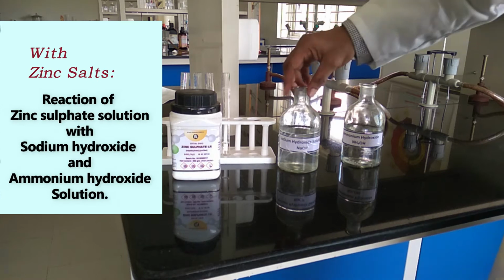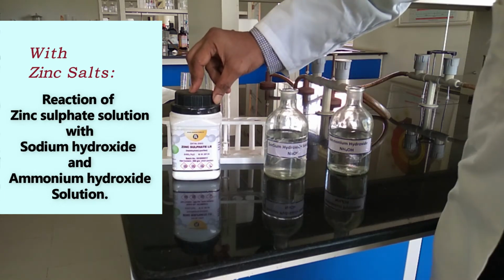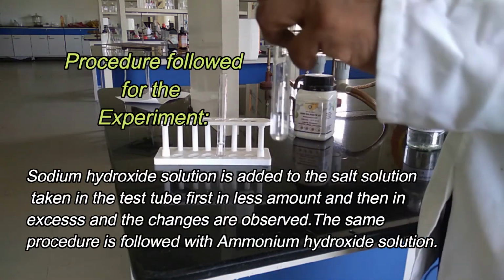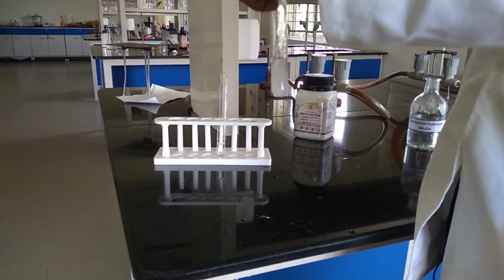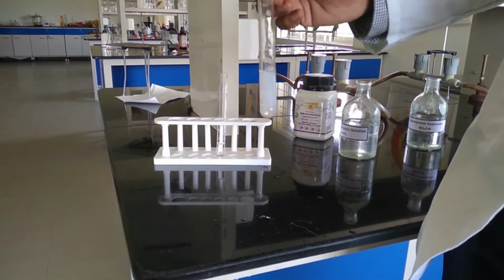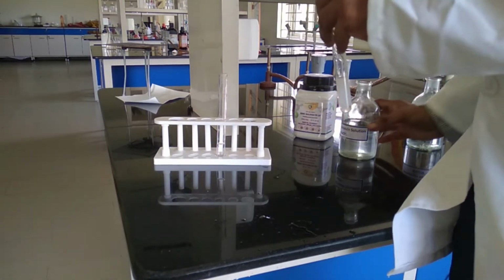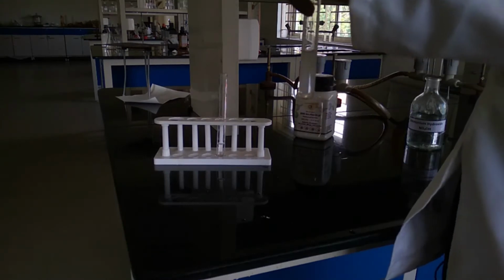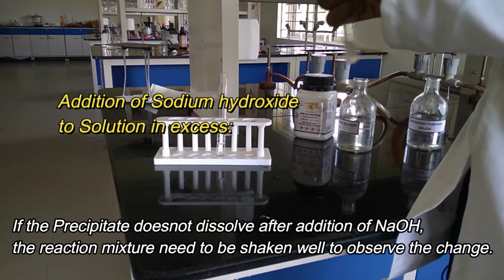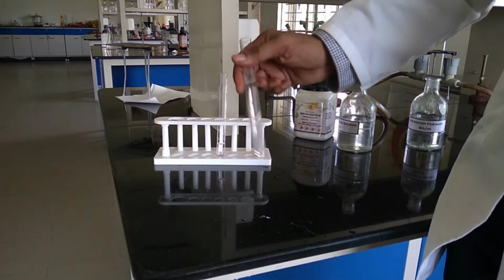Then we are going to see the effect of sodium hydroxide and ammonium hydroxide on zinc sulfate solution. First, we add a sodium hydroxide solution to zinc sulfate solution. It forms a thick white gelatinous precipitate of zinc hydroxide. See, we add an excess amount of sodium hydroxide into it. The precipitate gets dissolved. See, the precipitate got dissolved.